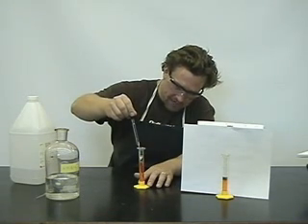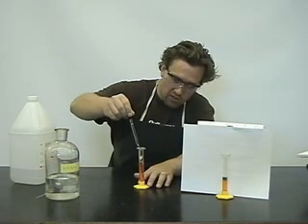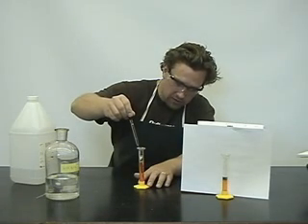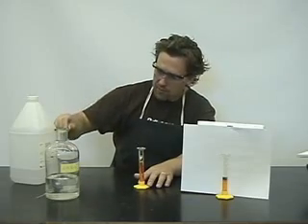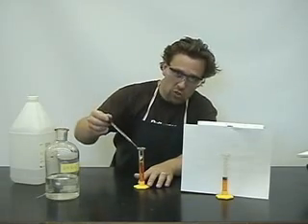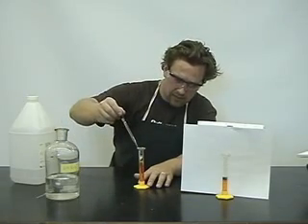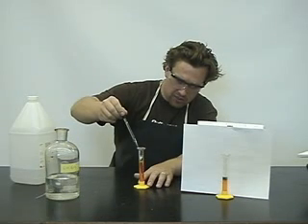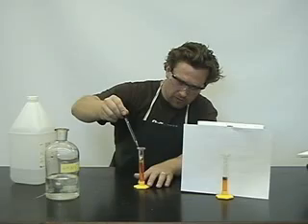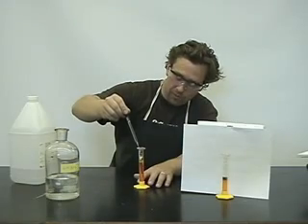Now what I've done is I've already started this reaction a little bit earlier. I'm going to add a bit more and you notice already a green color starting to form. Just do it nice and slowly so we don't mix the layers.